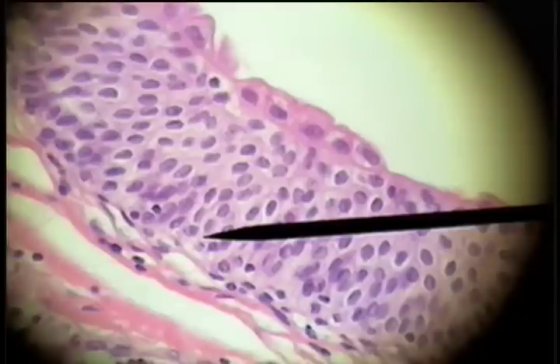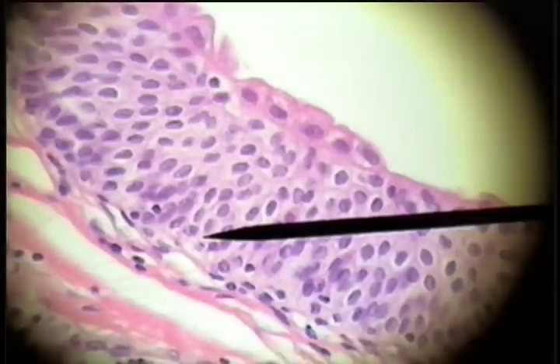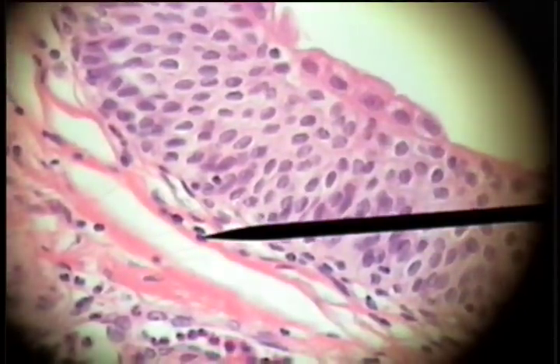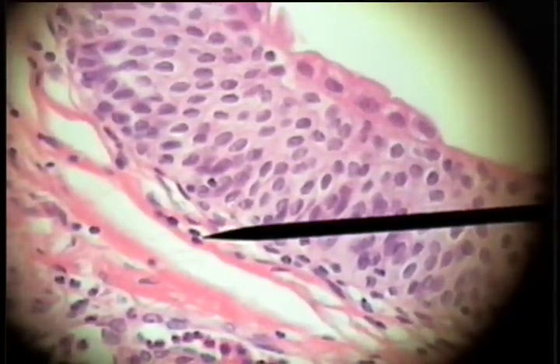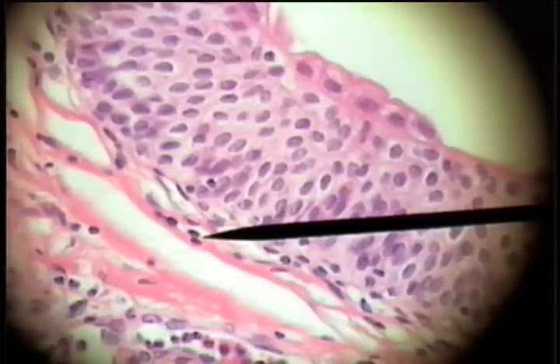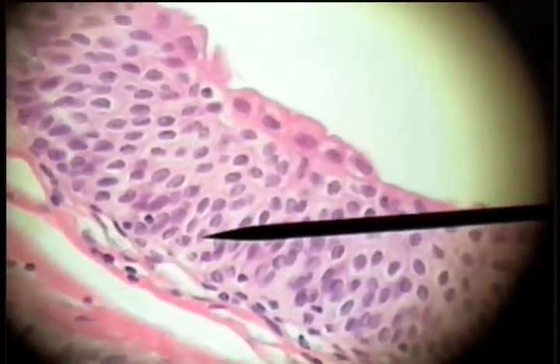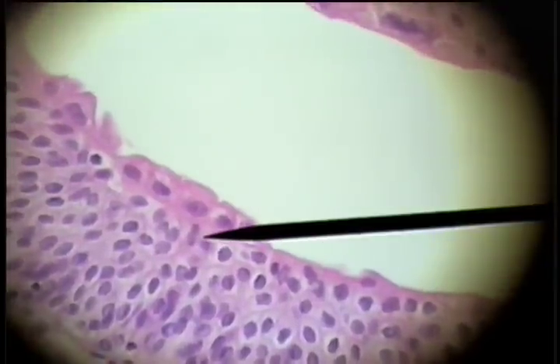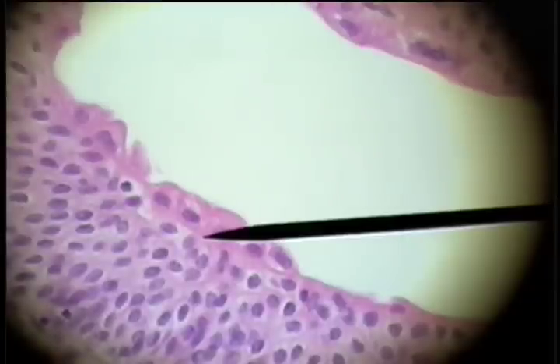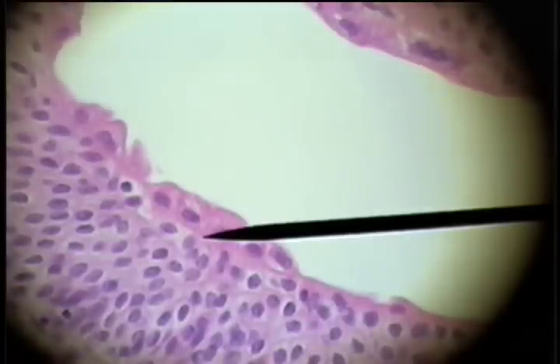The last epithelium type to be studied is called transitional epithelium. Here's the basement membrane. This is the ureter, the structure that conducts urine from the kidney to the bladder. Here's the basement membrane. Here's a layer of cells, and on the surface are these large round cells called balloon cells.